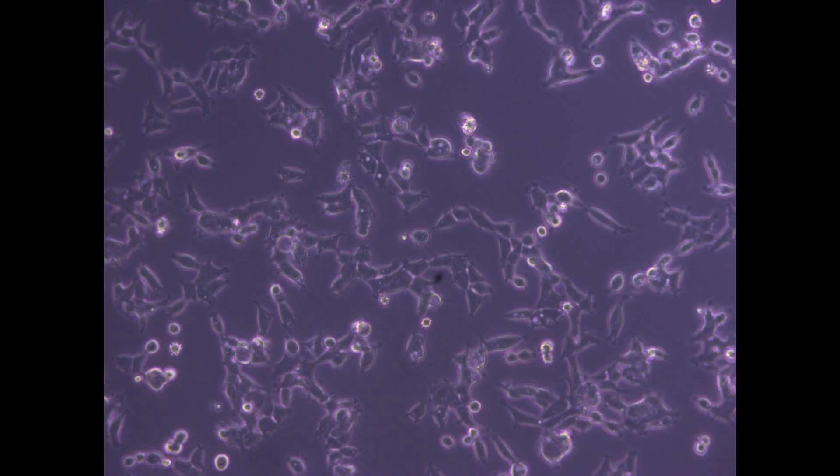We should see protein expression in 24 to 48 hours. This is what cells look like pre-transfection without any GFP, and if everything goes well we should see our cells expressing the GFP. It's a relatively simple way to express proteins in human cells — we'll talk about some of the differences between transfection and transformation later.